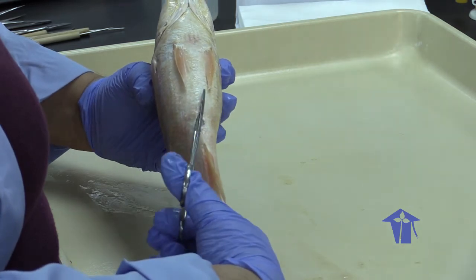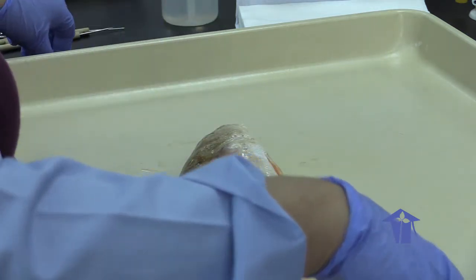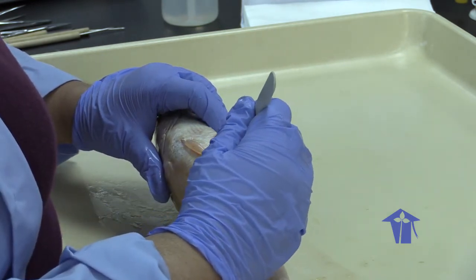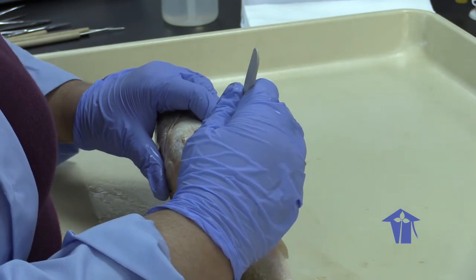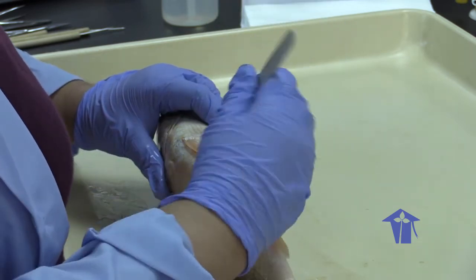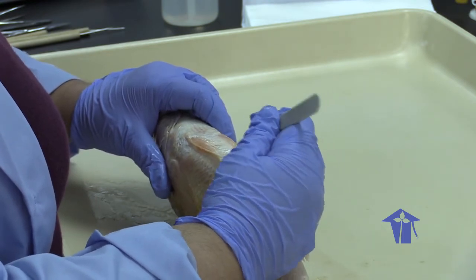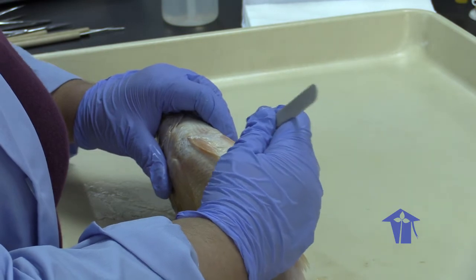And one thing that always surprises me with fish dissections is how little of the abdominal cavity is actually involved, how little of the body of the fish is actually a cavity. So I'm switching to the scalpel because the scissors are a bit dull. Okay. Just cutting up this mid-ventral line. That was just to get rid of some scales. When you're doing a dissection, you always want to aim upwards, because if you were cleaning fish and cutting down that way, you would rupture a lot of the internal organs.